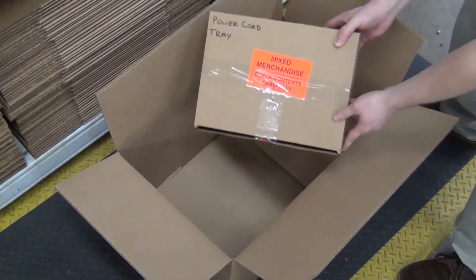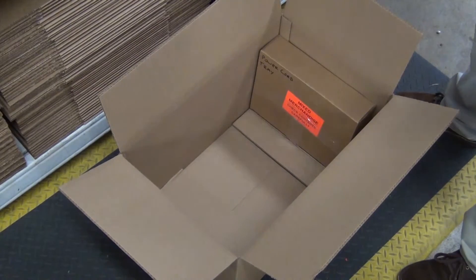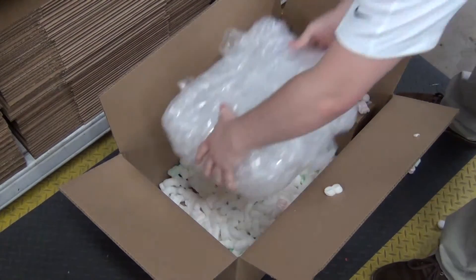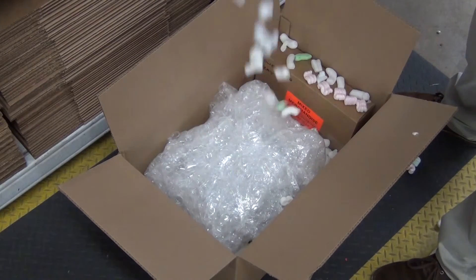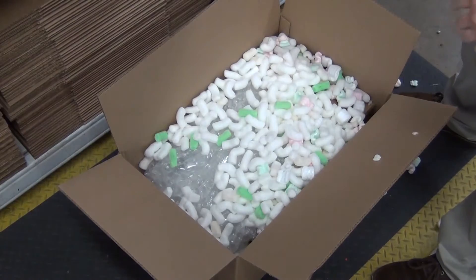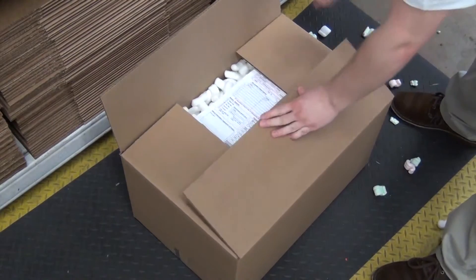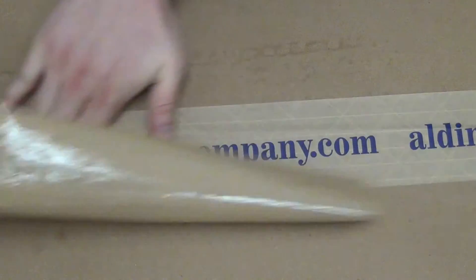For final packing, place the small box into the side of your large box. Add enough packing peanuts to cover the bottom of the box. Place your scale in the box and fill the rest of it with packing peanuts. Remember to place your service form in the box before packing up. Seal your package and it's ready to be shipped.